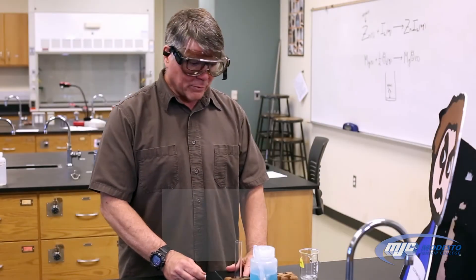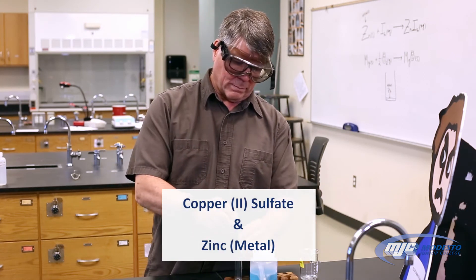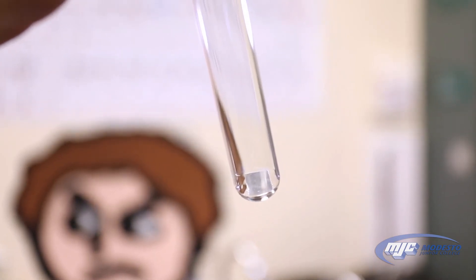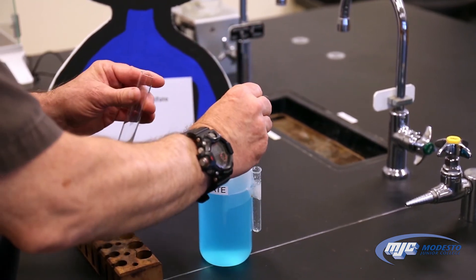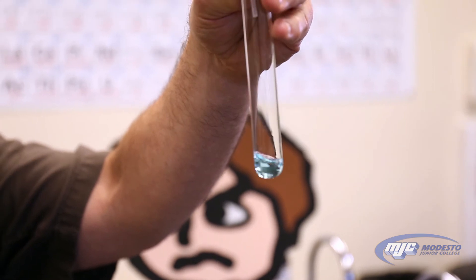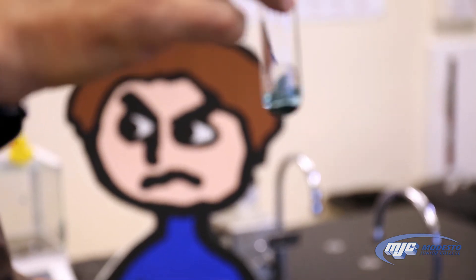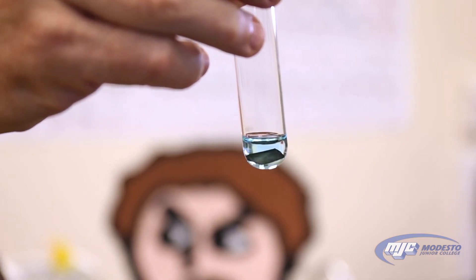This is the reaction, if any, between copper(II) sulfate and zinc metal. Two minutes later — can you see that?